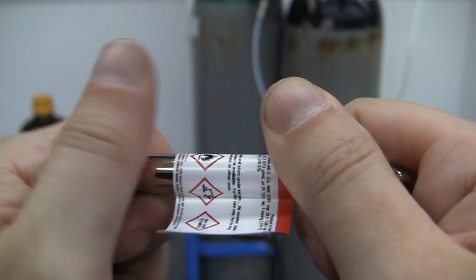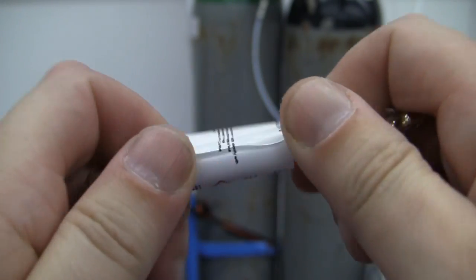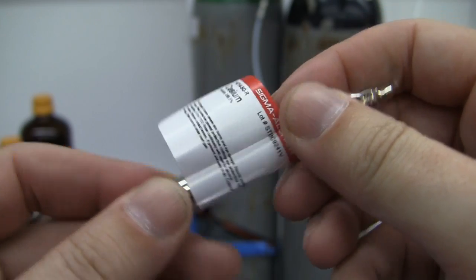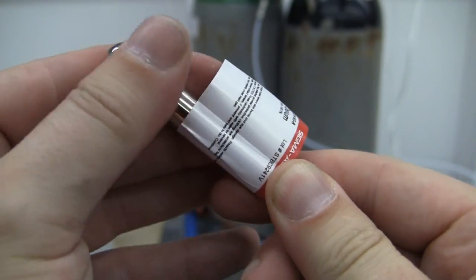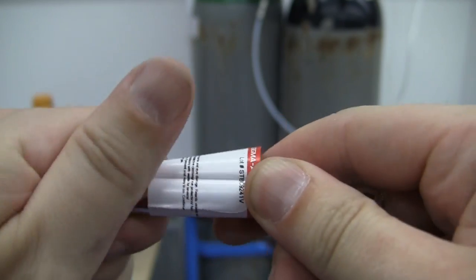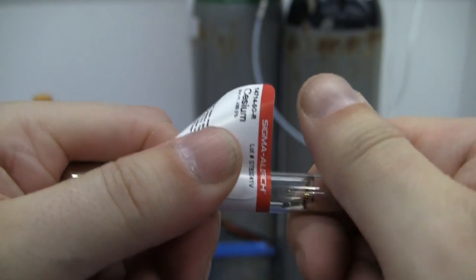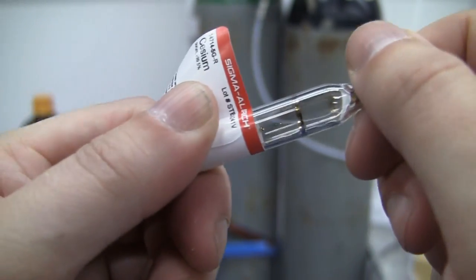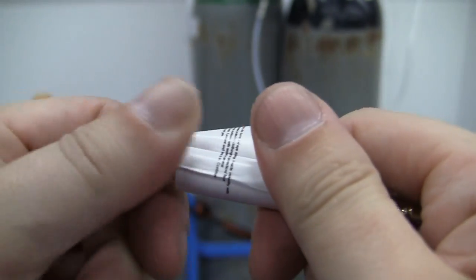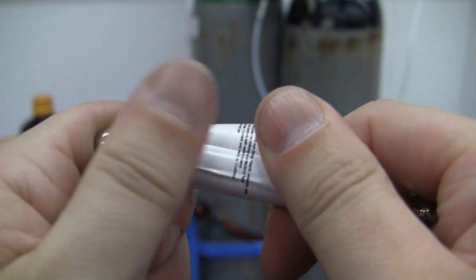I mean, this is about three to four hundred dollars worth of cesium. It's five grams. Okay, so we're molten already. Yeah, so it's about fifty to sixty dollars a gram, which makes it about the same price as cocaine.